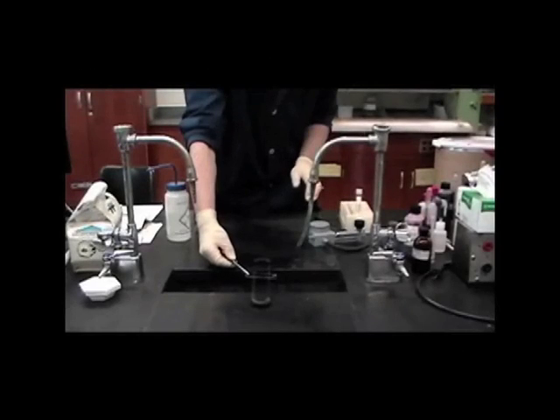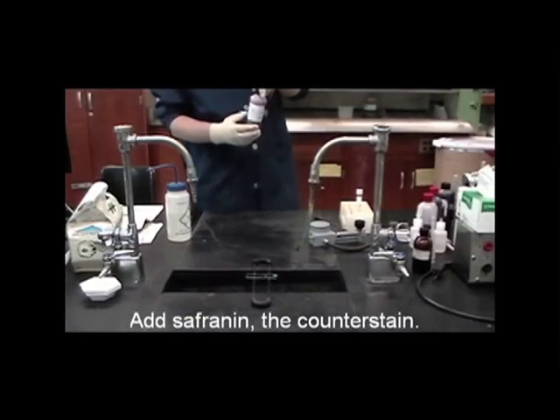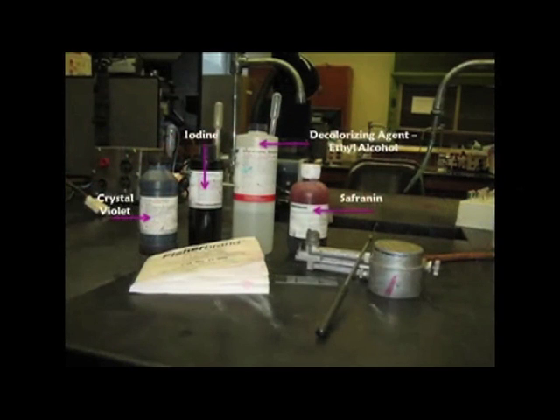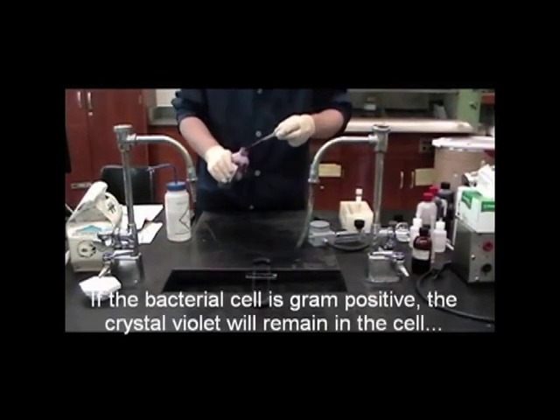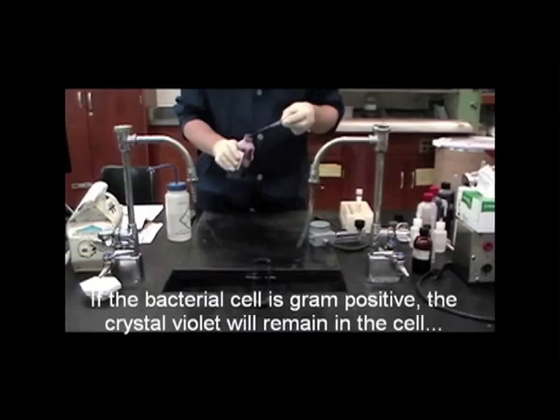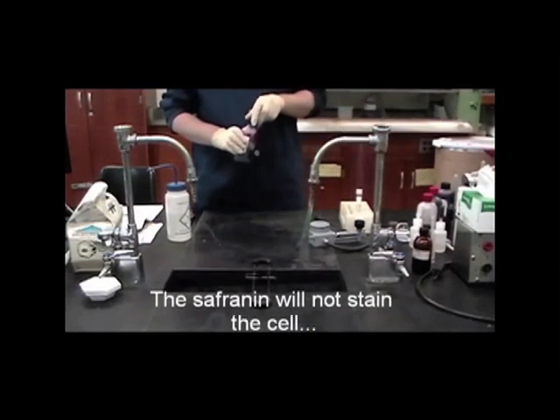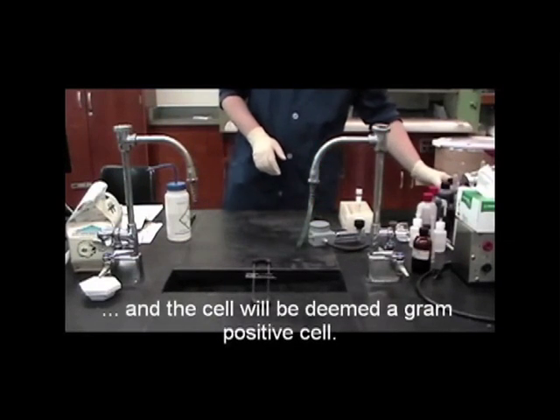The next step is to add the counterstain safranin, which is an orange color, for a period of 1 minute. If the bacterial cell is a gram-positive cell, the crystal violet will remain in the cell. The orange safranin will not stain the cell orange, and the cell will be deemed a gram-positive cell.